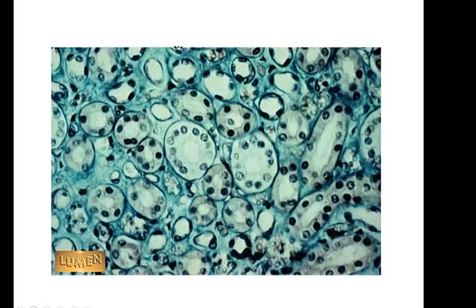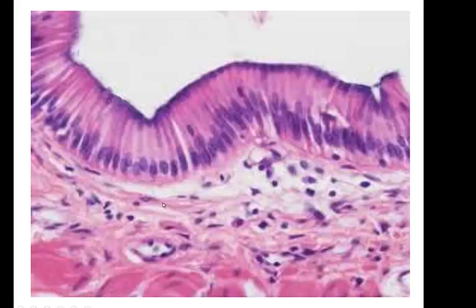Now let's move to the columnar. These cells are much taller, and usually, now this is a round nucleus, but usually the nuclei to the columnar are much more elongated. See how they're elongated? And another thing about the columnar cells, see how they're purple on the top here? That's because the stain, it stains much better on the edges, because on the columnar epithelium, these, I should go back.